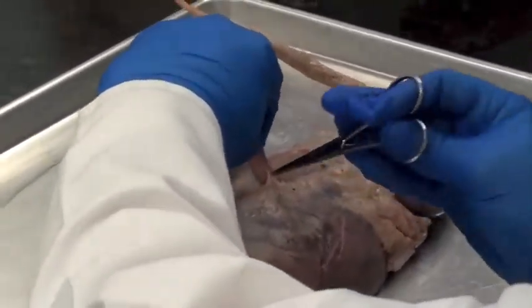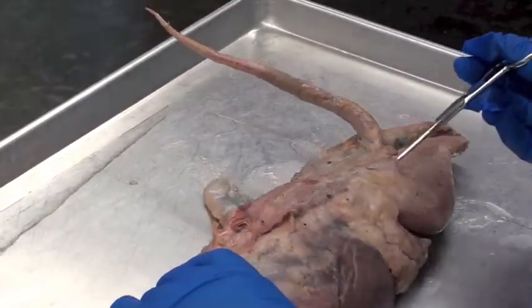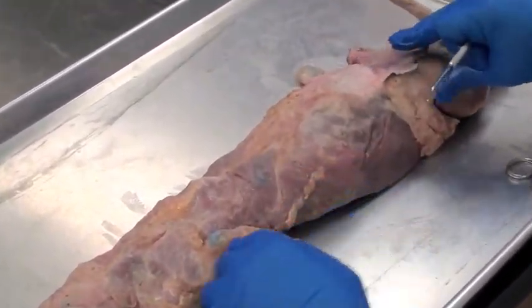In humans, we have no such muscle. Big skin muscle, or cutaneous maximus. When I see this muscle, I think it looks like big strips of bacon — I call this the bacon muscle. So we reflect it down to the mink's lower back and stop right there.